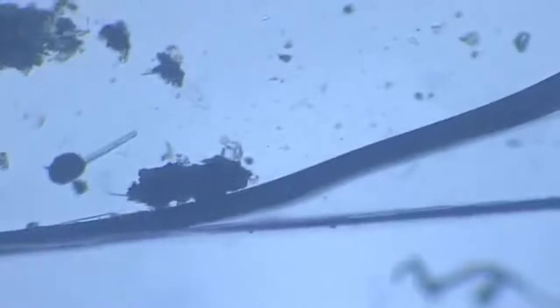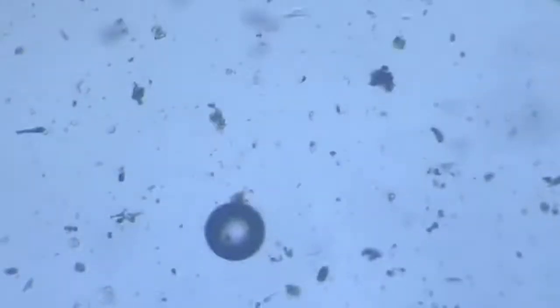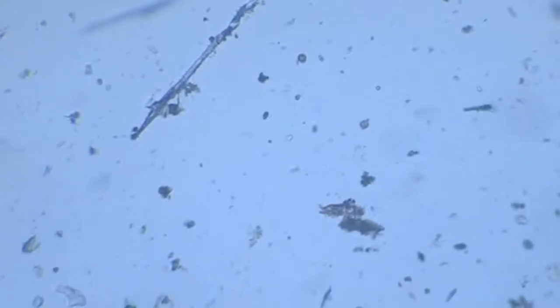What else should we look out for? There are some other creatures in this slide which are busy doing their own life stuff. We already came across a bacteria. We already came across an amoeba. Now let's try to find something more interesting. Though there are a few things interesting, but then suddenly, oh, there was one fellow. Did you see him going busy? So busy in his life.